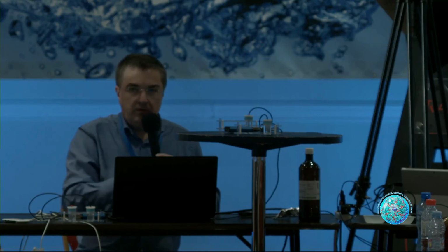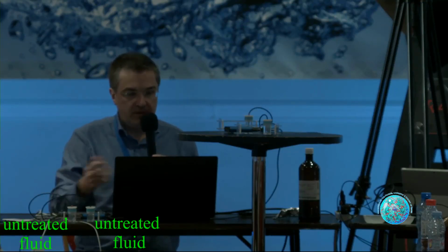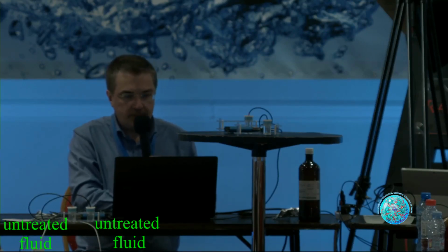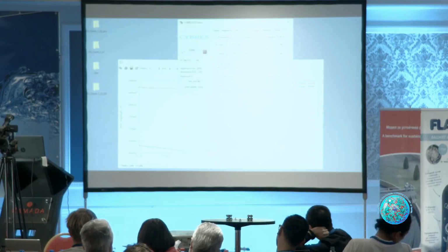Well, and now I would like to excite fluid and to see a dynamical response from a fluid. So for this, we implemented this excitation mode. It has high frequency and low frequency. You can understand it as a modulation with two frequencies.